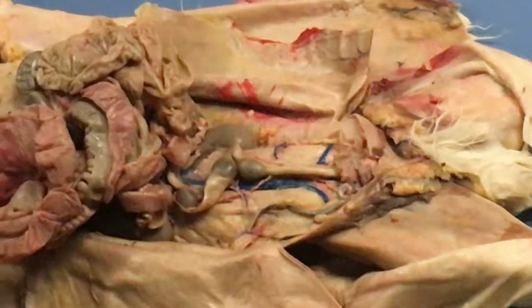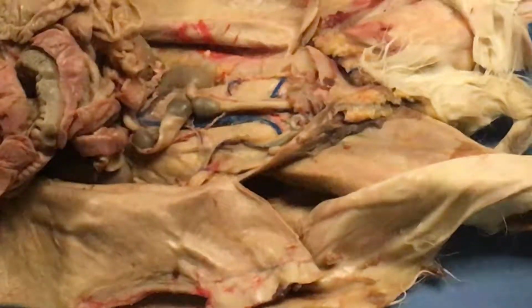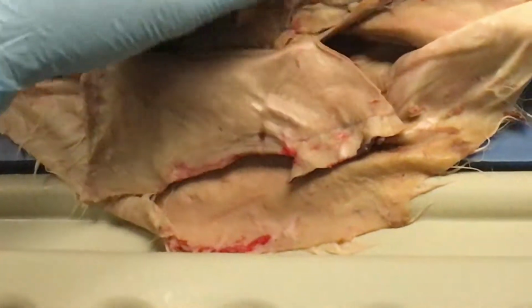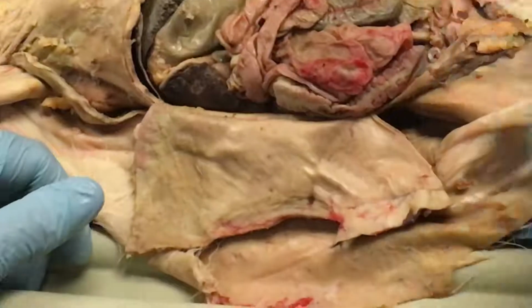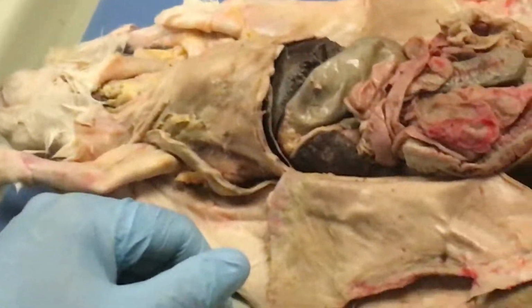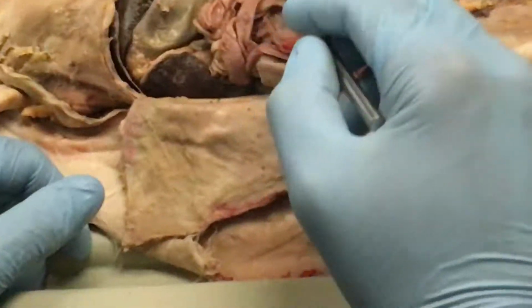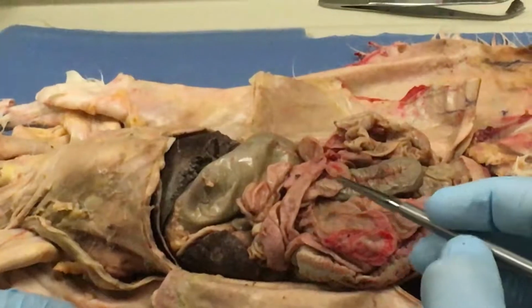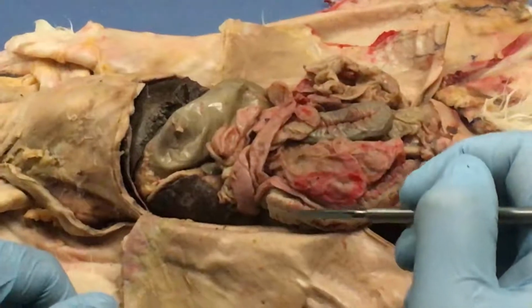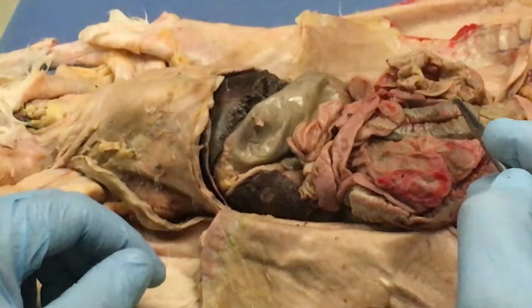Okay. All right, semen tubes, penis, scrotum, forget them. Okay. All right, so organs. Any questions? What's the function of the stomach? Break down food. Okay. What's the function of the small intestine? Absorb nutrients. What's the function of the cecum? To break down hard to digest plant food.